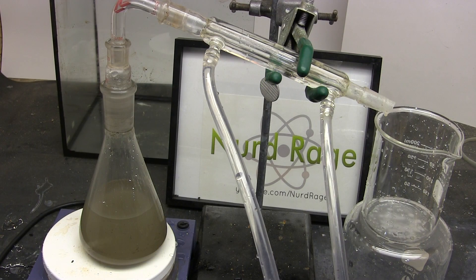Now it's time to set up a distillation apparatus. Turn on the stirring, the cooling and the heating and distill off the hydrobromic acid.